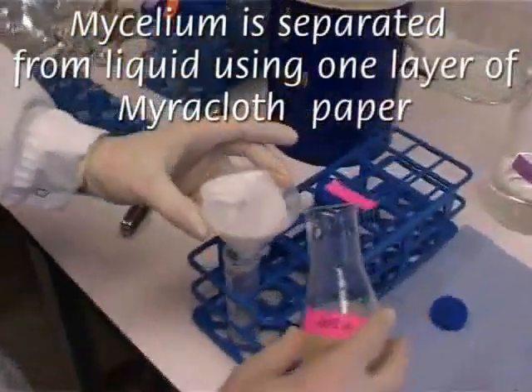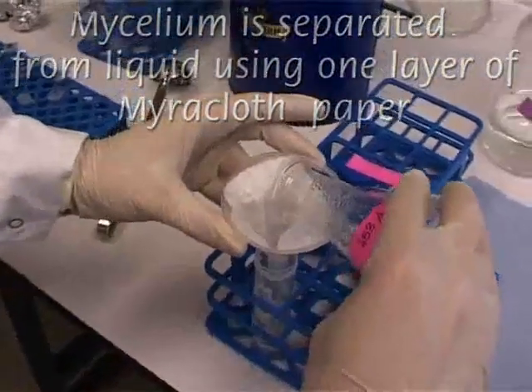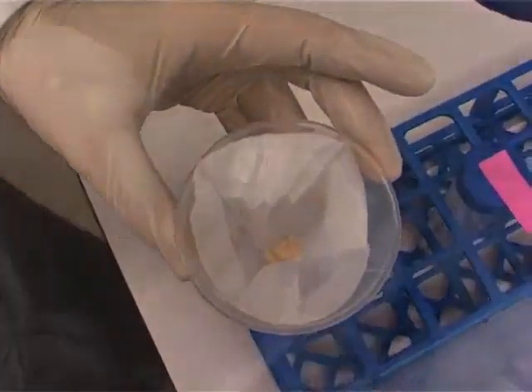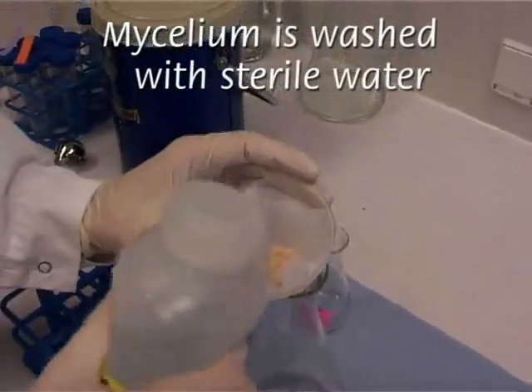The mycelium is then separated from the toxin-containing liquid by filtering on Miracloth tissue. The liquid can be used to measure toxin content, while the mycelium is used for protein extraction. To avoid media carryover, mycelium is washed 3 times with sterile water.